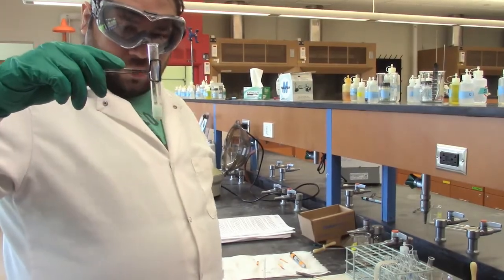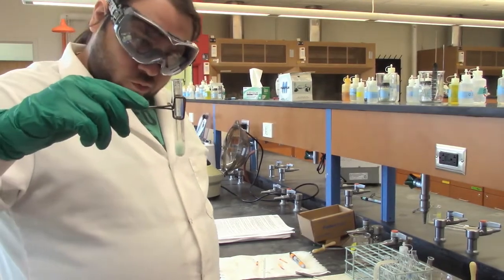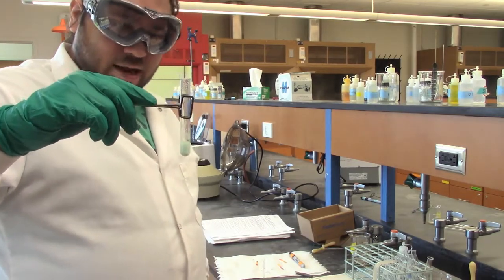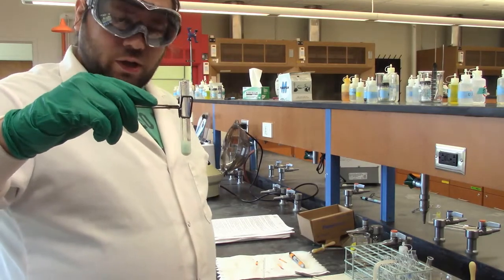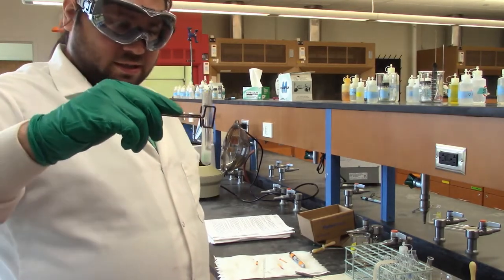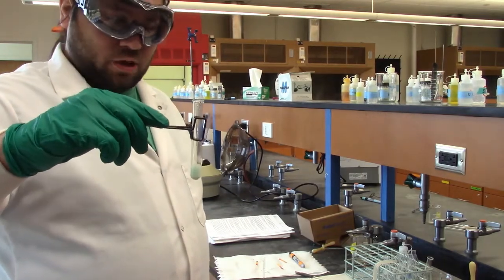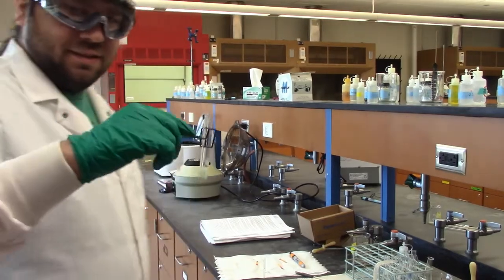So here we have our solution now, and we can pretty much see that there's copper and bismuth in there, but we'll follow the rest of the steps anyway. However, there is still some residue. There's some excess sulfur left over that I don't want anymore. So we're going to stick this in the centrifuge real quick, and spin it down, and get rid of that stuff. And then we'll come back, and we'll finalize our tests for the copper and the bismuth.